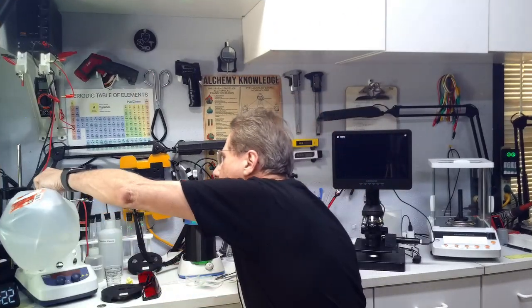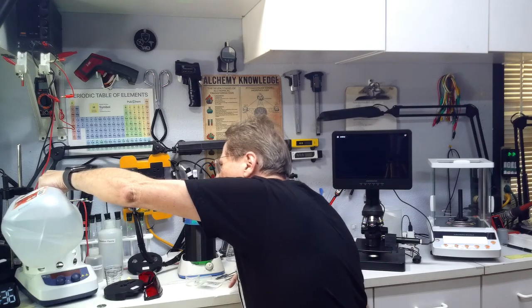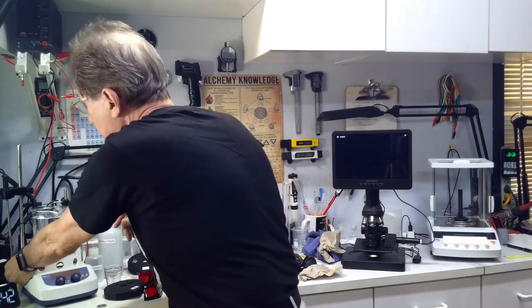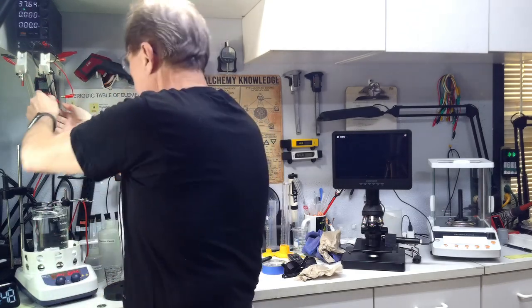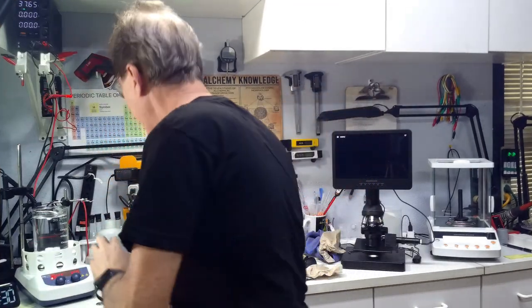I'm going to put about 550 milliliters of distilled water in here. Then I'm going to activate this and turn on the power supply. Now we need to measure current. I now have the rig properly set up so I can monitor the current.